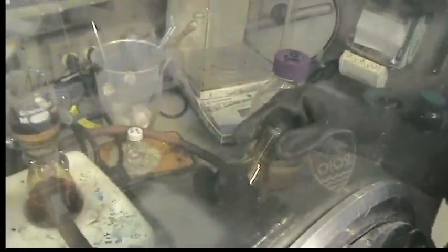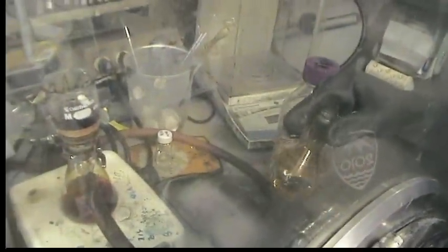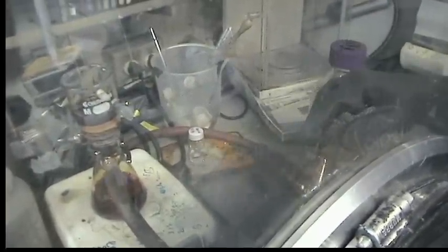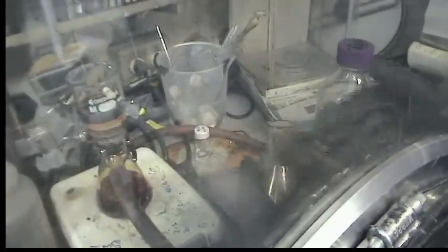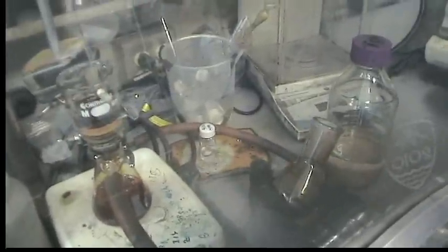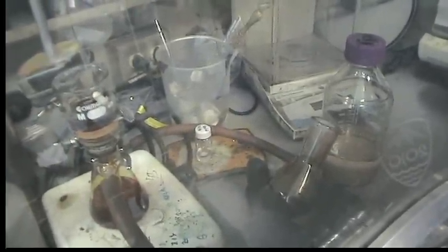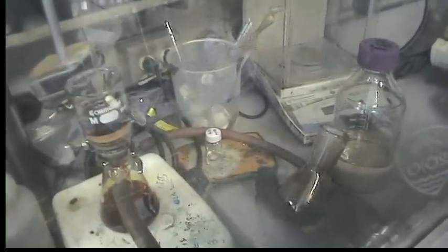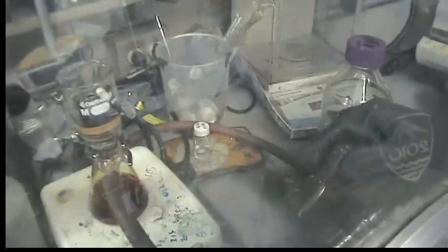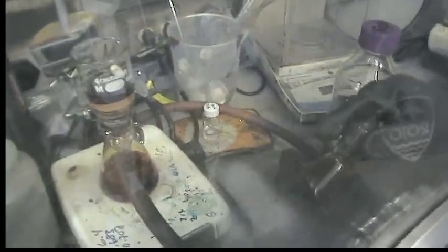And because it's a mixture of THF and toluene, it's going to take a couple hours to dry completely. So you want to definitely make sure your light's off and you're keeping things out of direct light. As I said before, ASP3 is not that sensitive to light, but certainly you don't want to take any risks of losing your compound. So you don't cover the reaction flask? No. While it's in solution, it's pretty not sensitive to light.